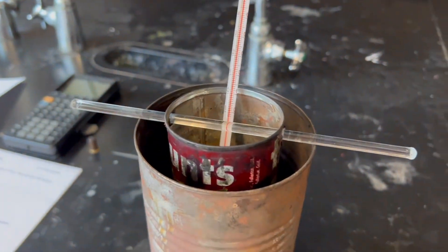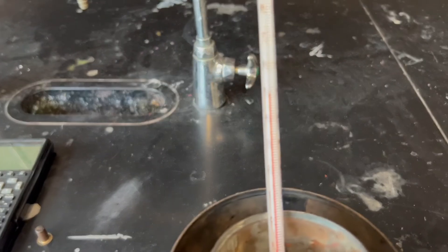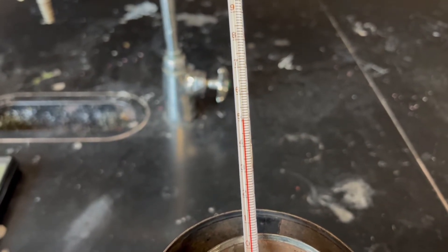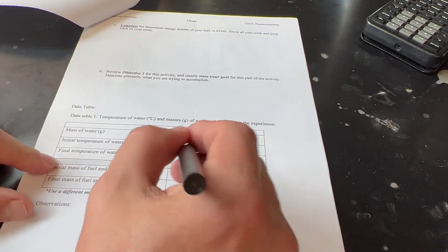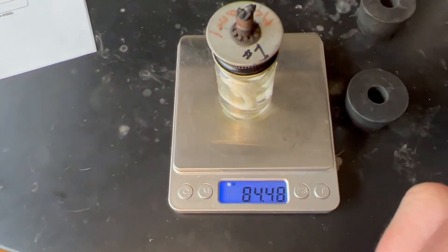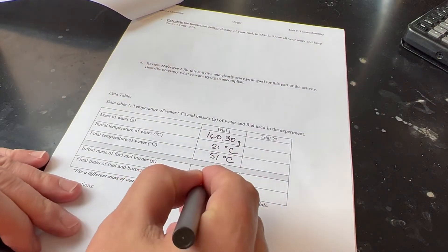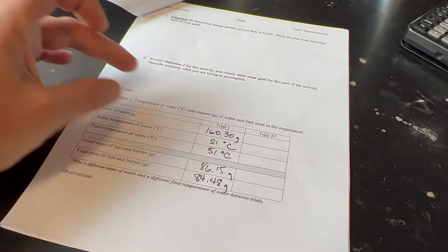We leave everything in place and wait for the highest temperature to be reached, since the temperature will continue to rise slightly after the burner is extinguished. The final temperature of the water is 51°C. We then measure the mass of the burner after the experiment: 84.48 grams. Now we have all the information we need.